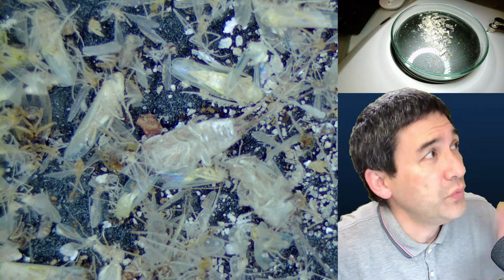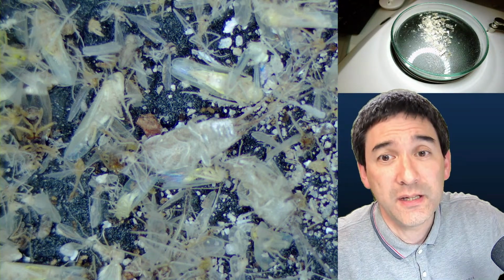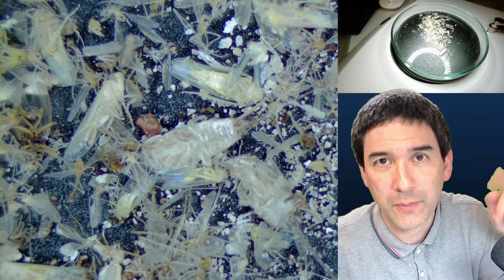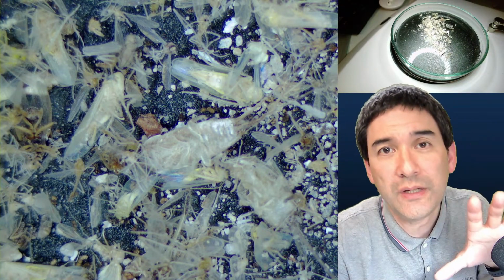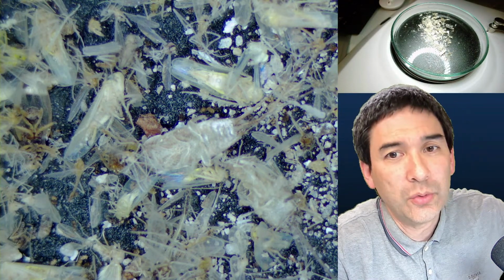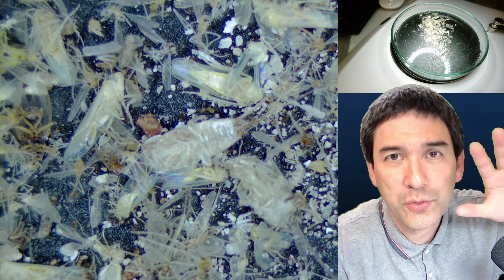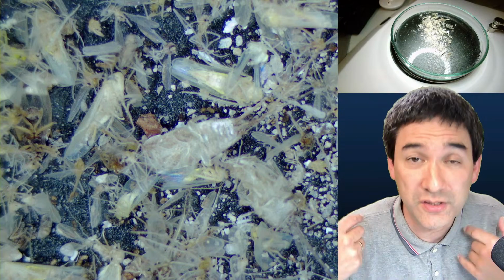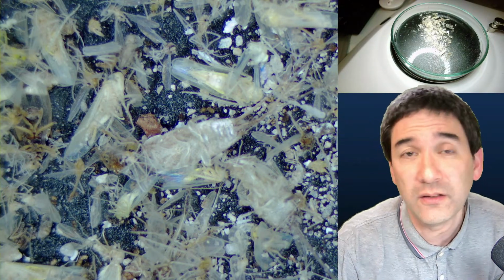One of the reasons why I bought myself an HDMI camera is that I've got two of them, one here and one on my other microscope from my other YouTube channel, because I can project it directly on a screen without having to go through a computer. I directly connect the HDMI cable to a monitor, and I don't have to wait for the computer to start and can just directly observe it on the screen. That's really a convenient thing.